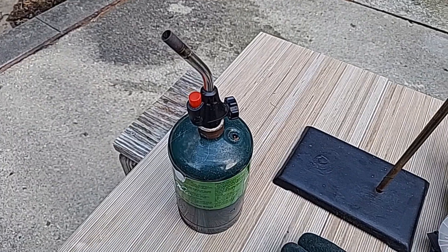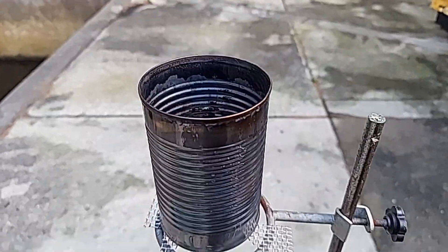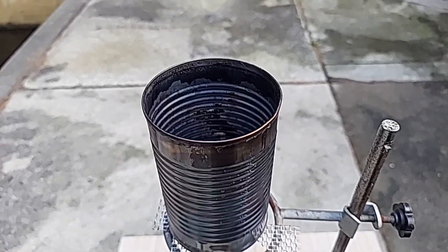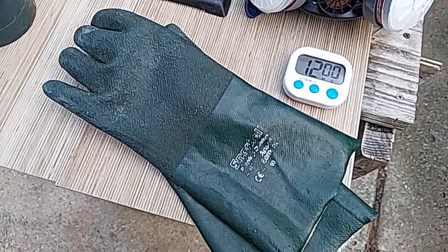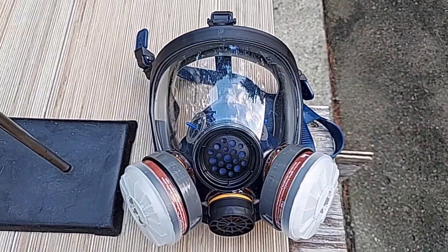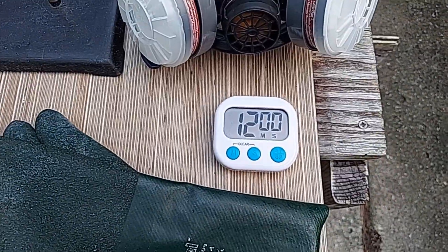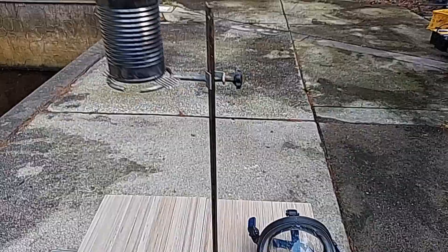There's my propane torch I'm going to use to heat it. I'm going to heat it until the water evaporates gently, and then really heat it red hot for at least 10 to 12 minutes. I'm going to be wearing these gloves, I have this gas mask on, and my timer's set to 12 minutes. I'm going to get going on this right now.